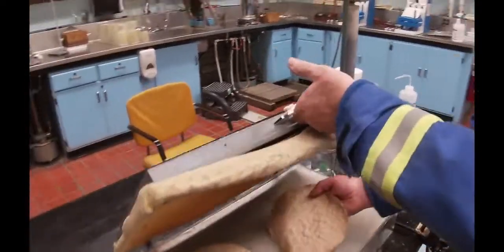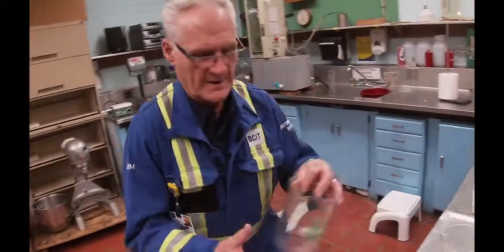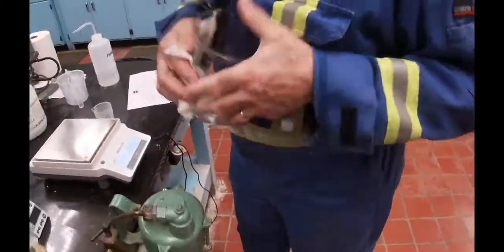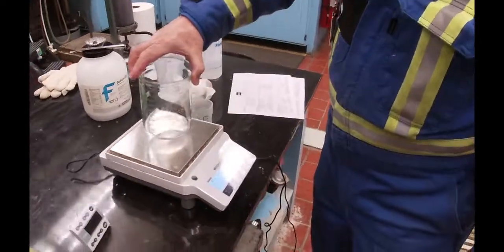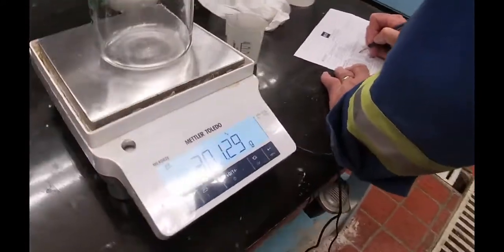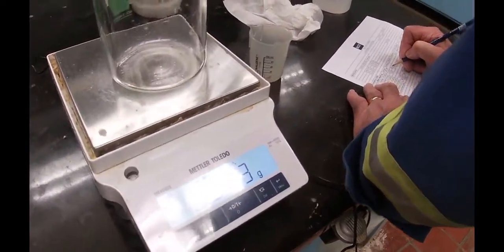This is number two and I think I have a number written on the back side. The filter, plus the slurry — and I will get the weight of that beaker in a moment. That's going to go in there as sample number two. And this is going to be sample number three. The number two beaker weight is 301 grams.